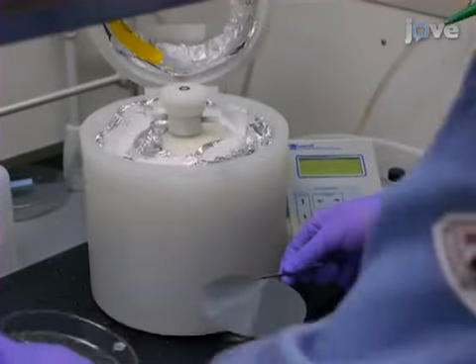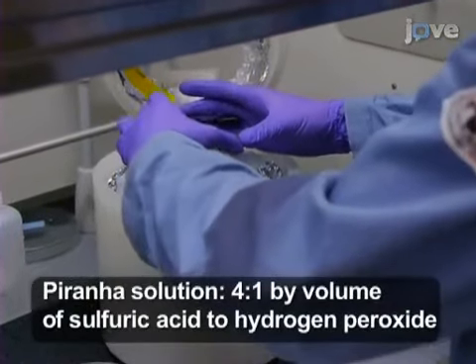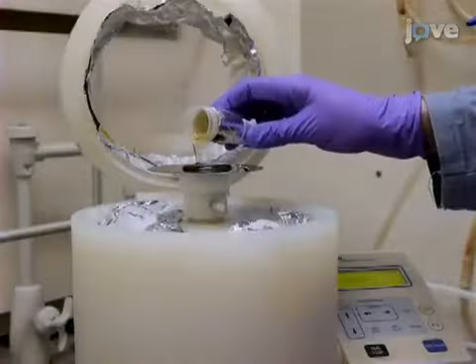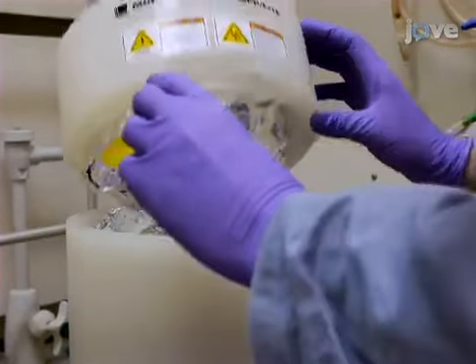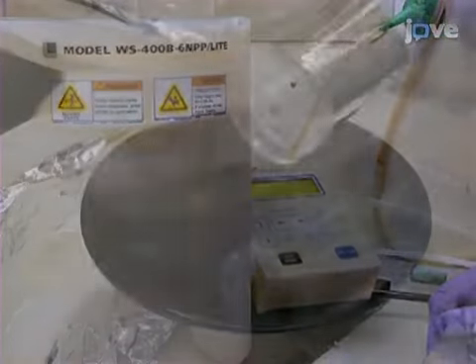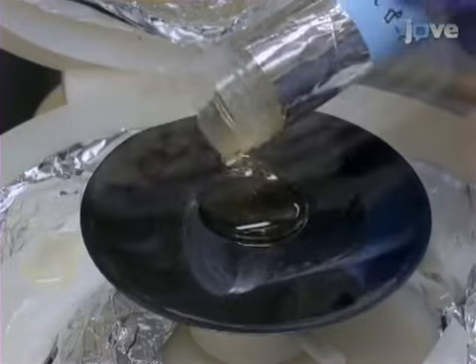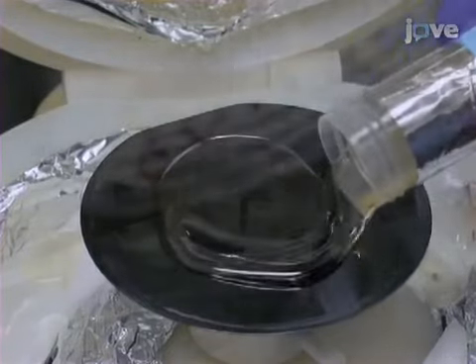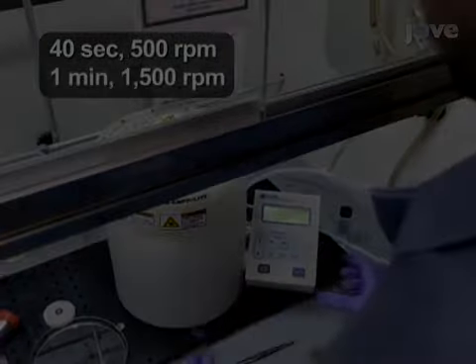Prior to starting this procedure, clean a 4-inch silicon wafer with Piranha solution. Following this, spin coat SU8 2002 onto the surface of the wafer for 40 seconds at 500 RPM. Next, spin coat SU8 2050 onto the wafer with a 2-step spin coater program for 40 seconds at 500 RPM, followed by 1 minute at 1,500 RPM.